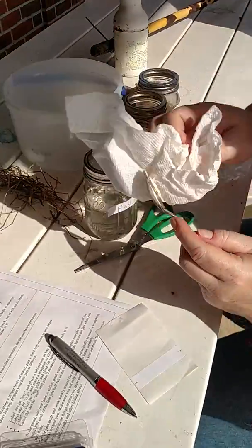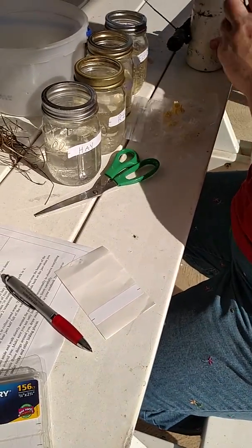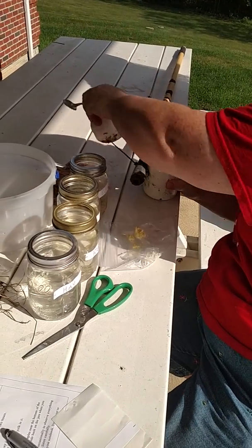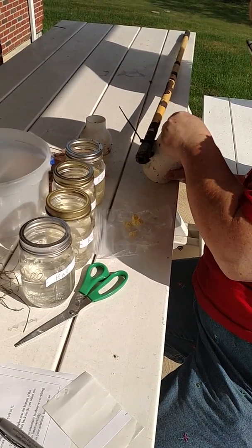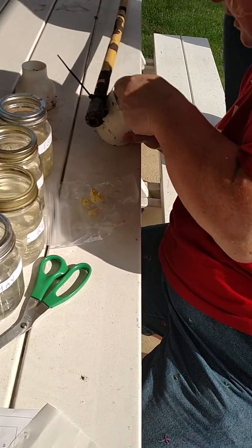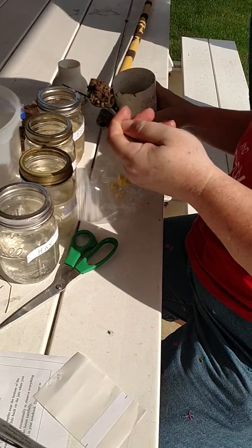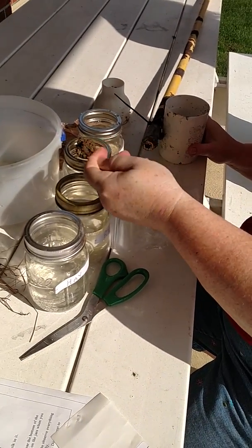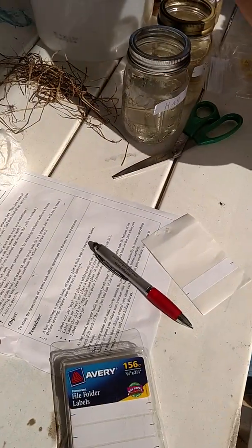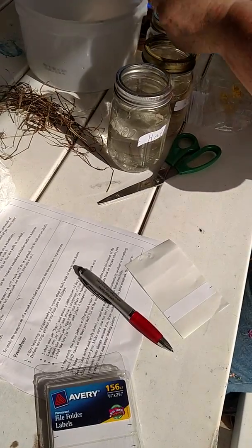That will settle down to the bottom. Before I left the pond, I got some of the dirt around the edge of the pond. There's a little bit of grass — I'm going to ignore that. There may be a few rocks, but that's okay, as long as there's some dirt. About a teaspoon of soil, drop that in there. It'll get cloudy but eventually it will settle. I see there's a little bit of something floating — I'm just going to go ahead and take that out.